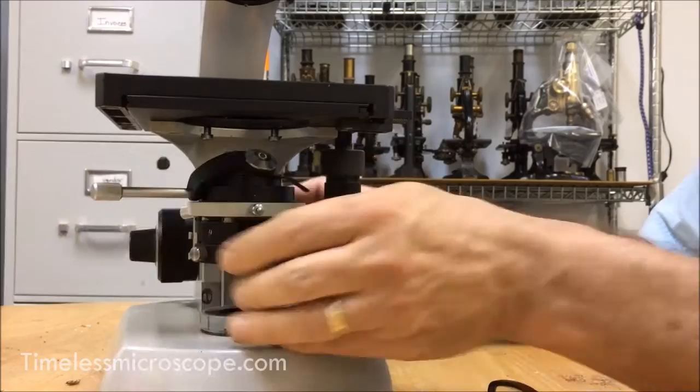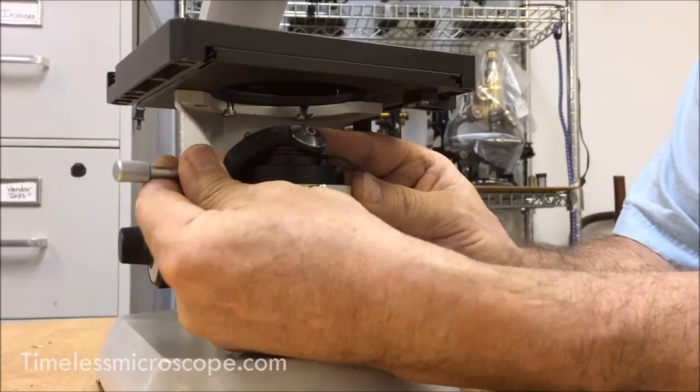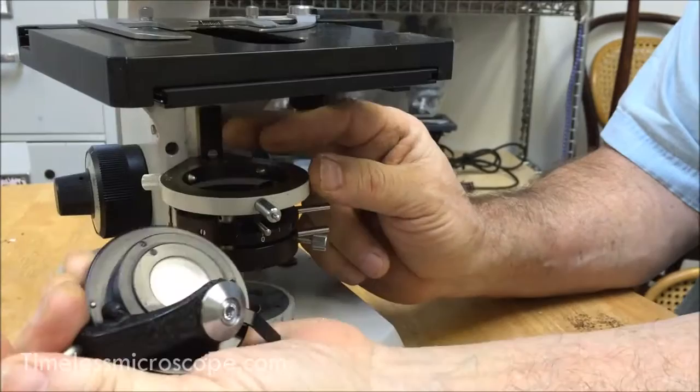Now you have room. You want to swing the top lens into the downward position to give it more clearance. There are three points of contact in all these old Zeiss — two are centrable but one is spring loaded. You want to push it towards the front, which is spring loaded. You see that piston moving? It's telling you it's working. And then you lift it out like that.